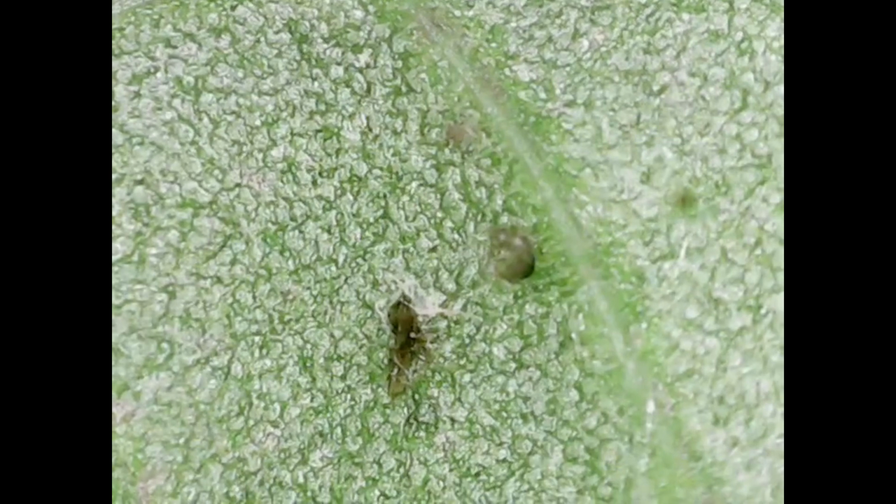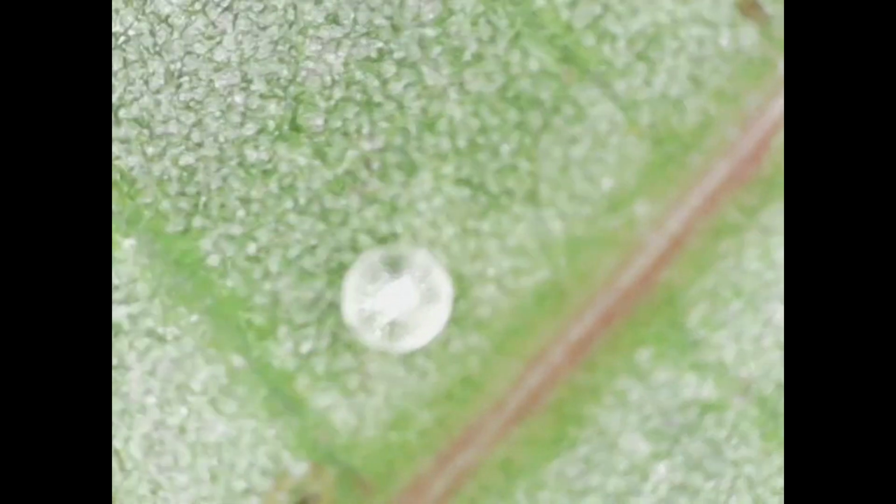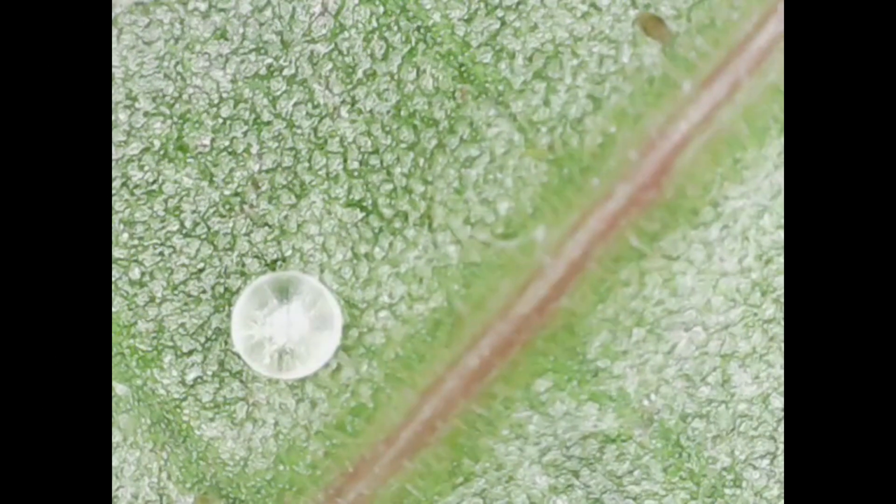So here it might not be fully apparent at the moment. You can see those little black dots. That is Extrafloral Nectaries that have oxidized. You can see it there. There you can see a clear Extrafloral Nectary, so that would be what we see as white, which when it's not under the microscope.